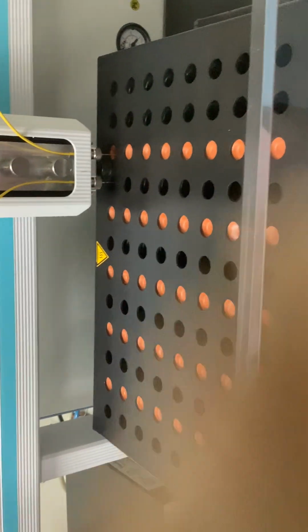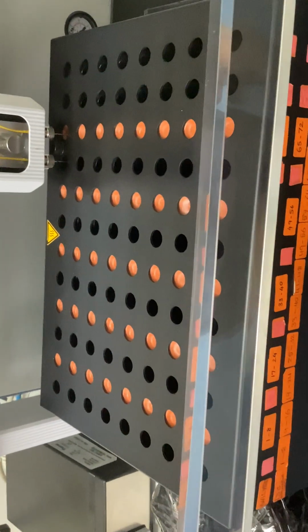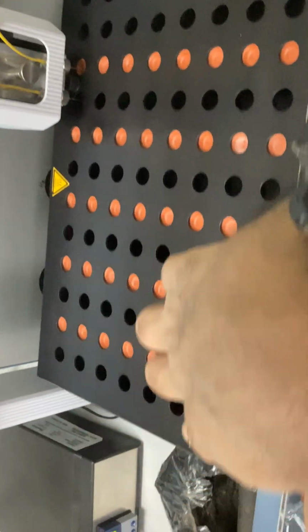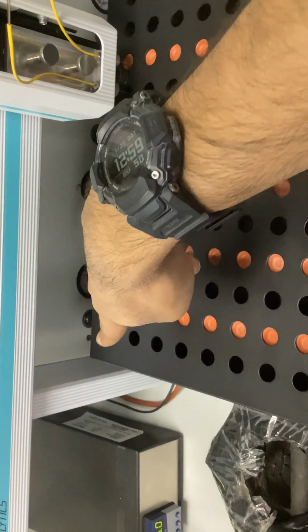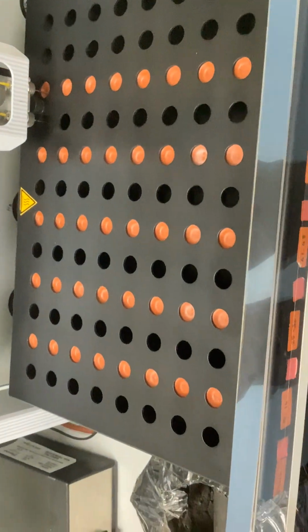Went in the tube, whereas the flush needle has gone into the hollow, the tube which is empty. There we have not kept any sample. That slot is empty. When you're flushing, let's say I need to do both flushing and analysis, so I put the vials here. Don't keep it in the first one, because you will have two needles, so you will end up breaking one, because one will go in when you do the flush.